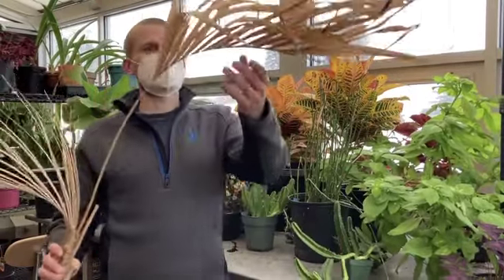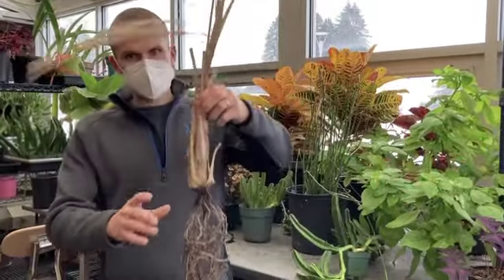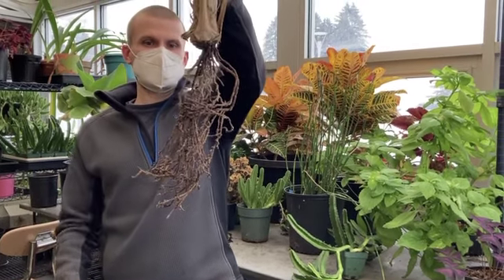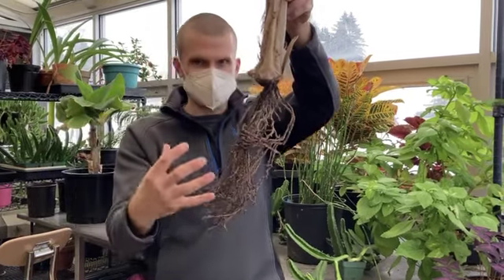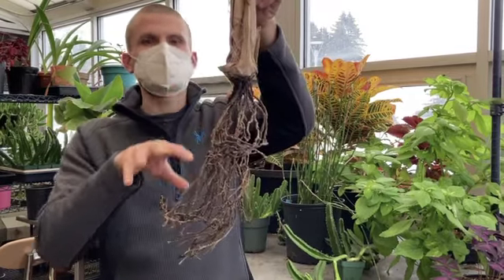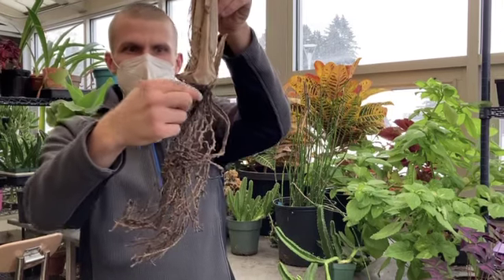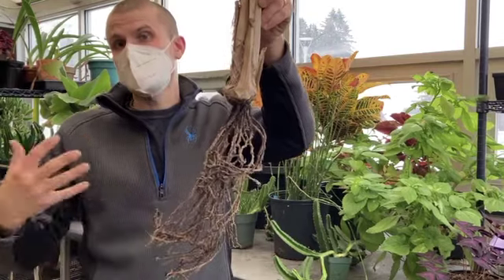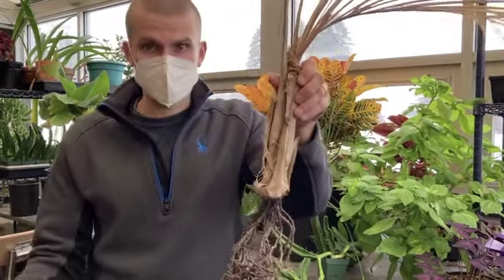So here we have a dehydrated palm, one I dried quite a long time ago, because its root system is very emblematic of this adventitious or distributed or fibrous root system. I prefer the term fibrous because this looks very much dispersed. You don't have a single axis. You have multiple roots with no one being more dominant than the other. This helps keep our monocots in the ground and absorbing a lot of water the moment it rains.